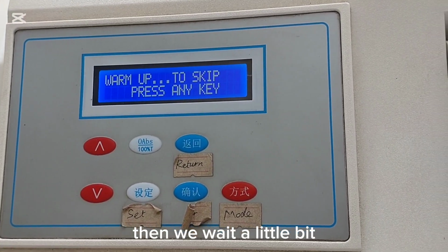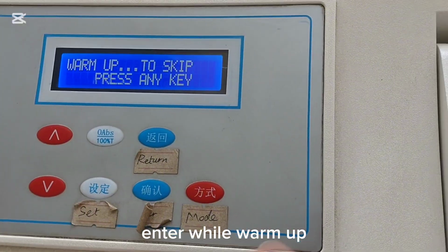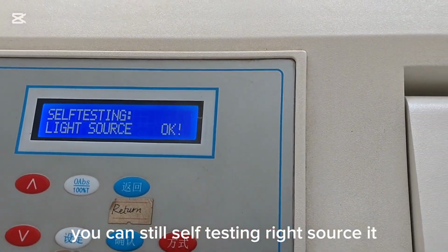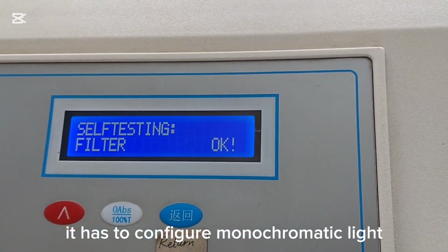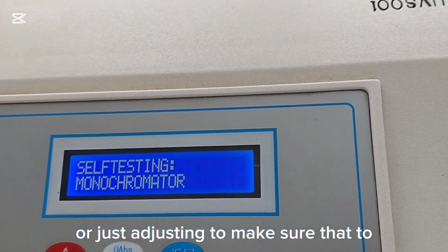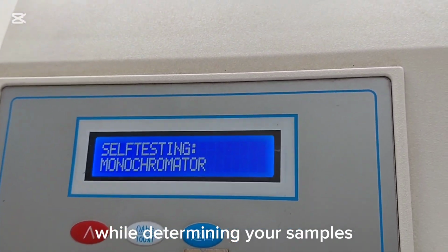Then we wait a little bit, and they are telling us to press any key just to move on. Then we have, for example, to click enter while warm up. If you want to skip, you can press any key. That's what they are saying. You can still see self-testing of the light source. It has to configure the monochromator light. You see that the monochromator light is being set or adjusted to make sure that we pick one light source to be used while determining your samples.